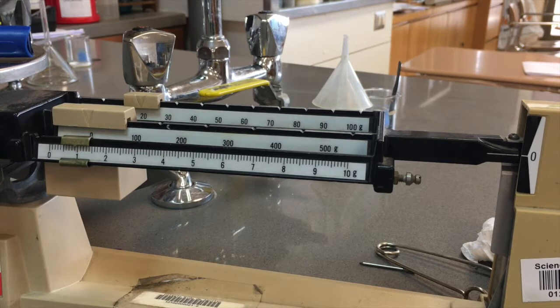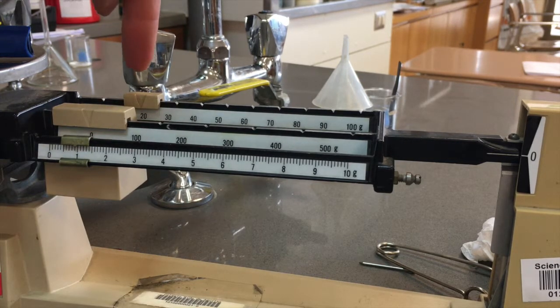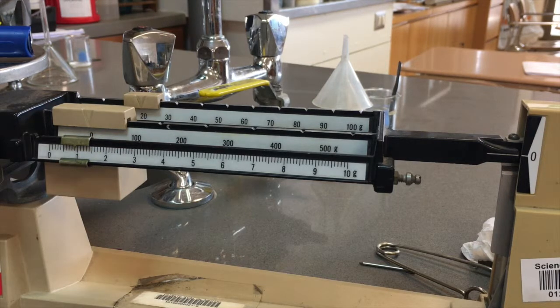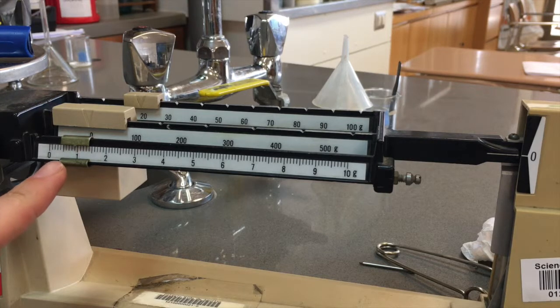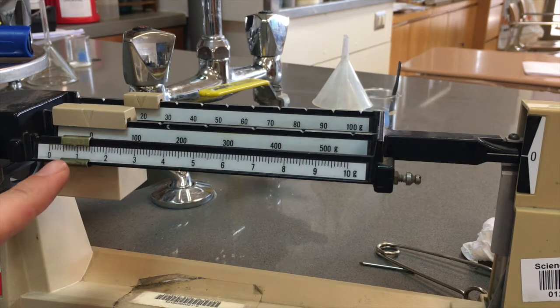Okay, now if I look at what the masses are, we've got 20 here, and then to 20 I'm going to add what this reads out. And if I look there, it's somewhere in between 0.9 and 1. So I'm going to say 20.9.